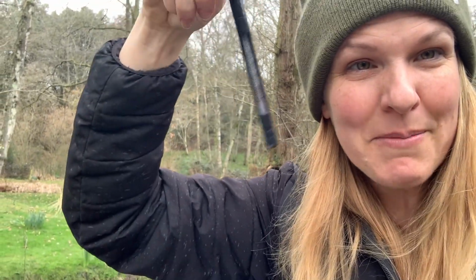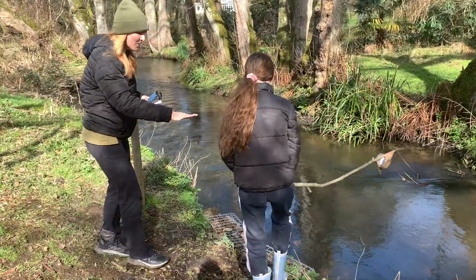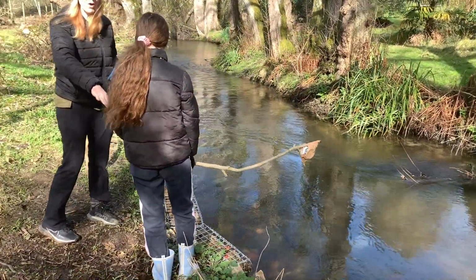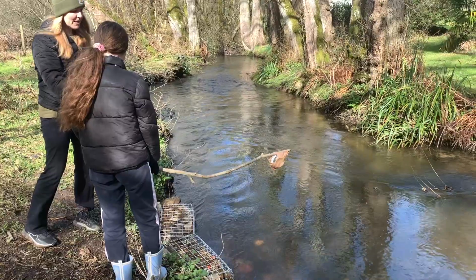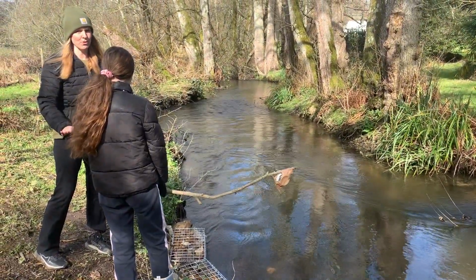Once you're finished your visual assessment, you're going to get out your thermometer and you're going to check the air temperature as your first measure. Rebecca's going to demonstrate the proper technique for taking a sample. We're going to make sure that we're nice and safe on the shoreline here. Hold on to a person if you're a bit worried. If it's really not very steady here, make sure you find a spot that you're not worried about falling in. It's really, really important that you're super safe.